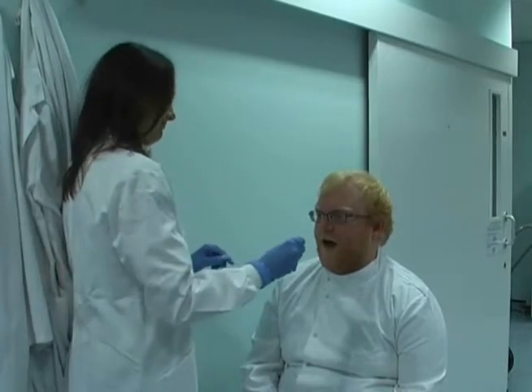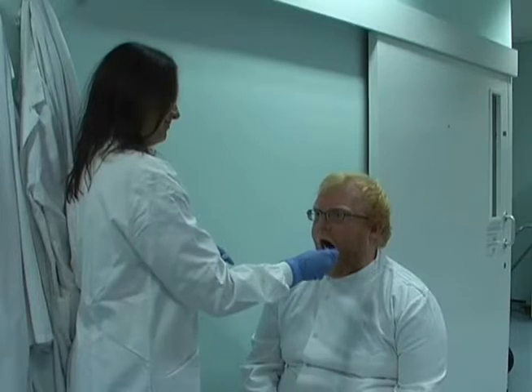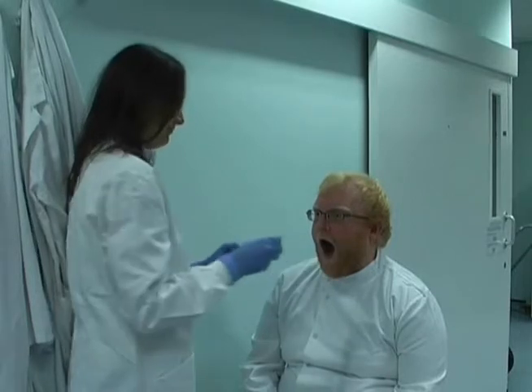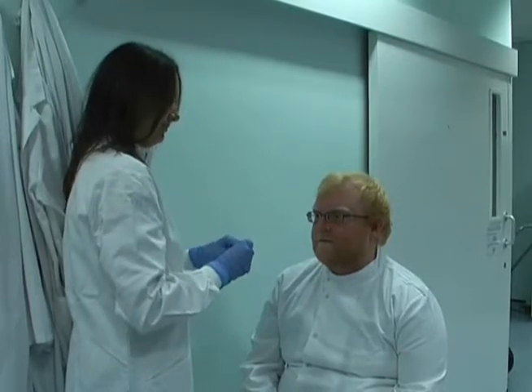In order to obtain a sample of DNA to amplify and test using PCR analysis, we are sampling the inside of our volunteers mouth with a sterile swab.